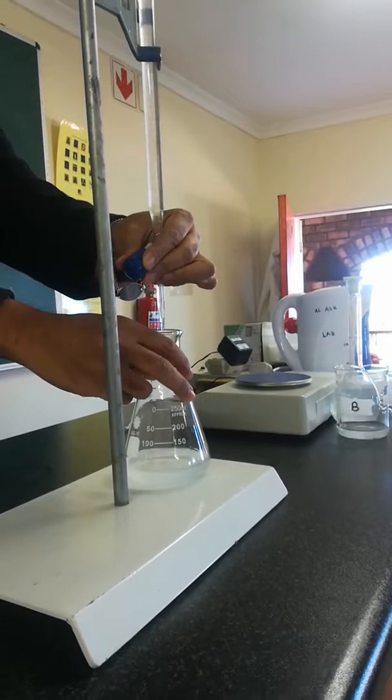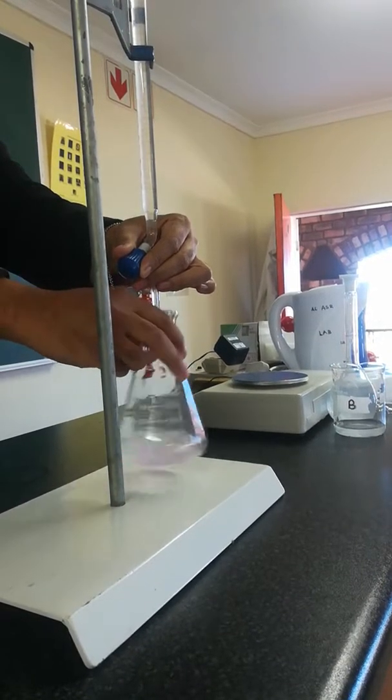Okay, you see it's getting, it's taking longer to dissolve. So we're reaching the end point.